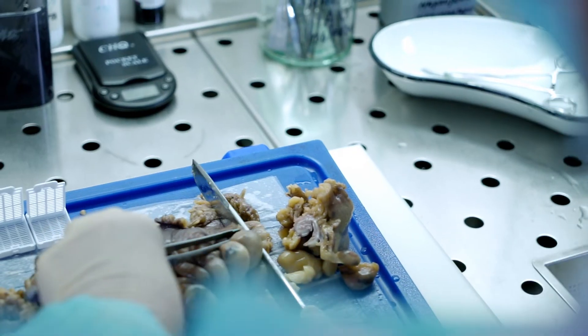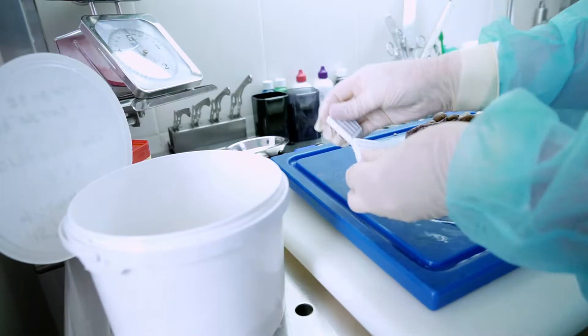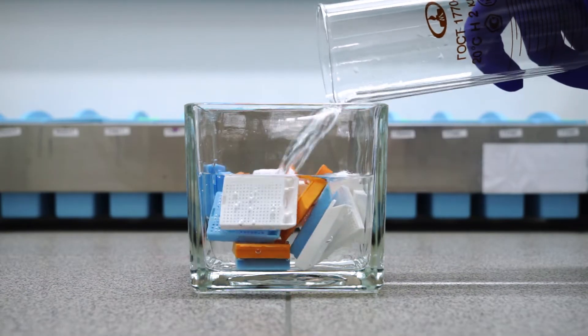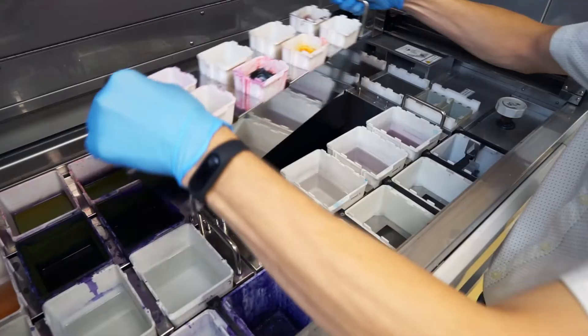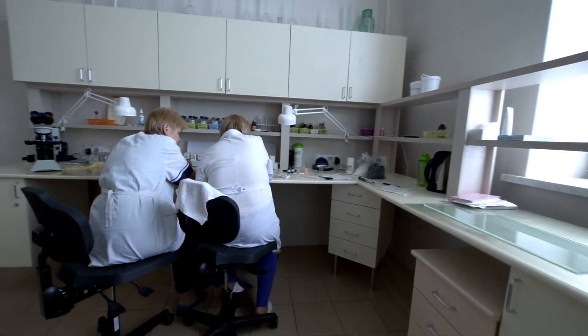All the samples in the laboratory are stained with this method. There are several different types of hematoxylins and eosins, and they can give us different results. The result of the staining can vary depending on many factors, including quality of solutions, type of tissue, protocols of the prior steps, and even the quality, salinity and pH of water used in the lab. That's why there is no universal protocol which can be used everywhere. The protocol should be validated according to your specific conditions.